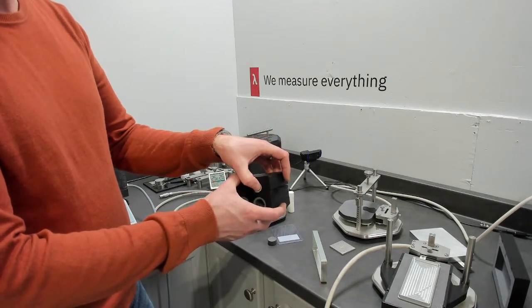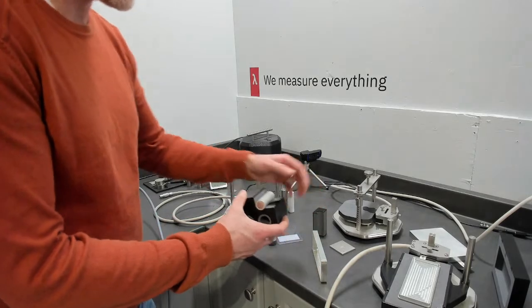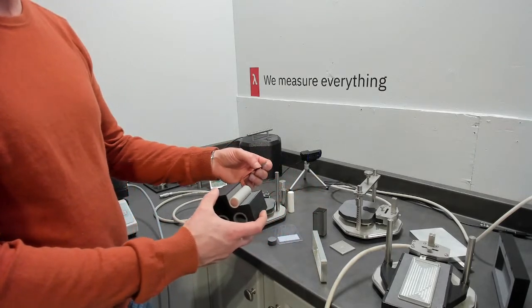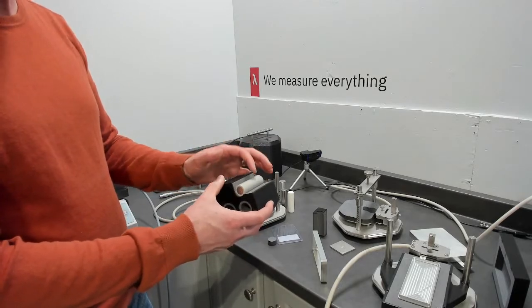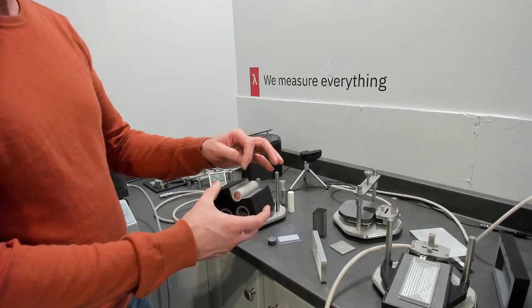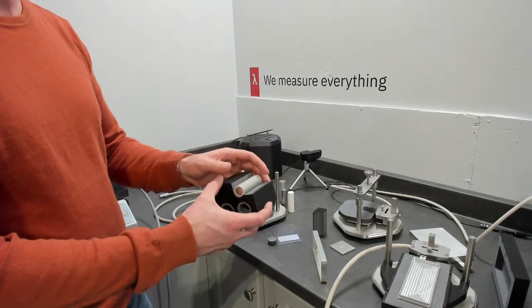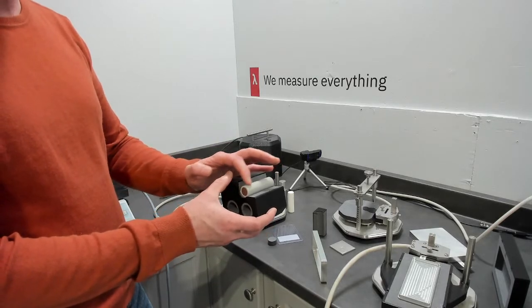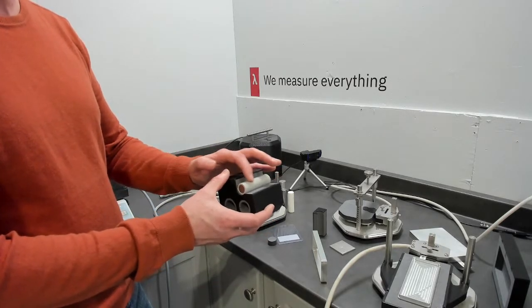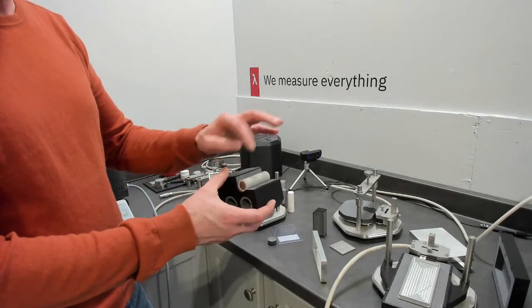Now, a question that comes up is, this is not a flat sample, so how does the sensor and the math accommodate the curvature? We have a proprietary curvature correction for measuring with the Transient Plane Source method for rounded materials. There is still some error associated with having an insulative layer and a very conductive shell, and then the jelly roll inside it.